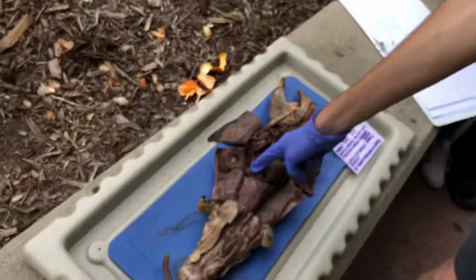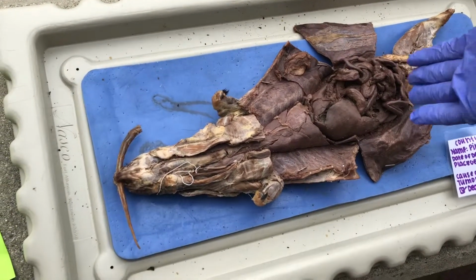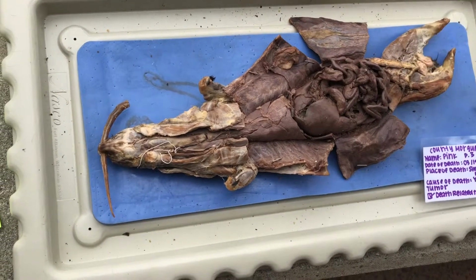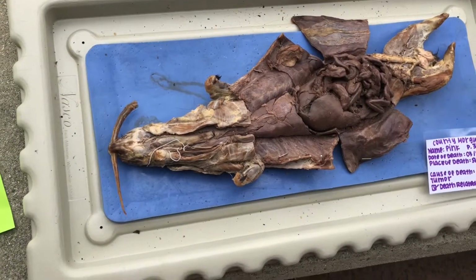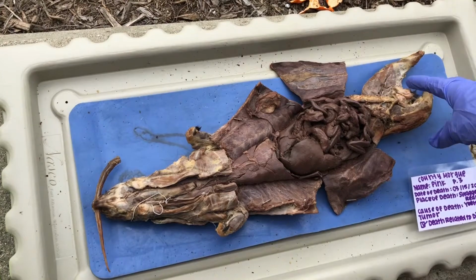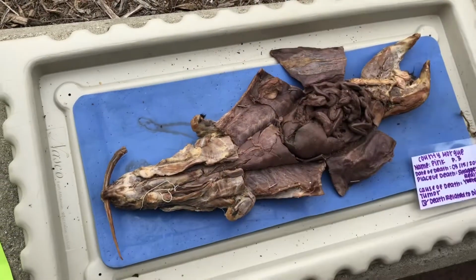Diaphragm. It's right here. The diaphragm separates the thoracic and the abdominal pelvic cavity, or just the abdominal cavity. There's the serosa. There is a parietal layer, which is the outermost layer, and there's the visceral layer, which would line the organs. There's the cranial cavity, the thoracic cavity, there's the abdominal pelvic cavity, but up here is just the abdominal, and here's the pelvic cavity. And there's also the spinal cavity, but we don't really worry about that one.